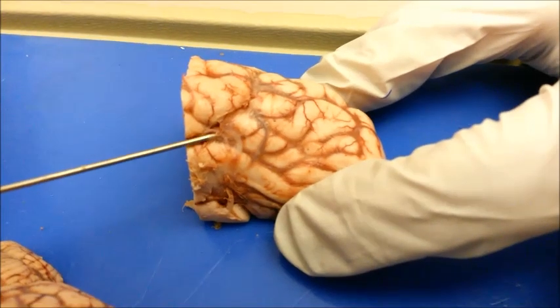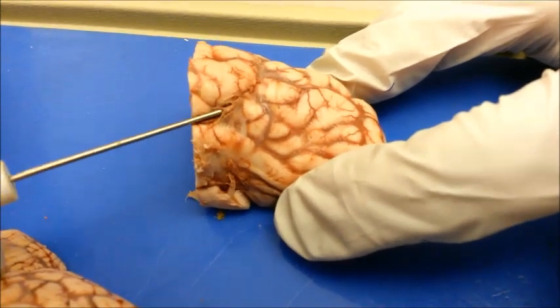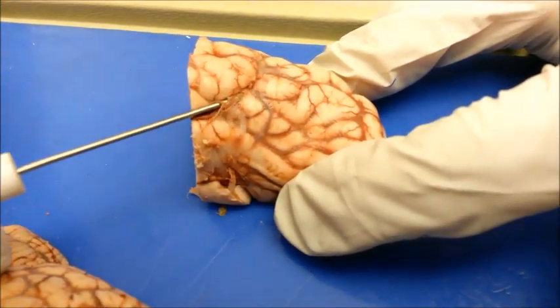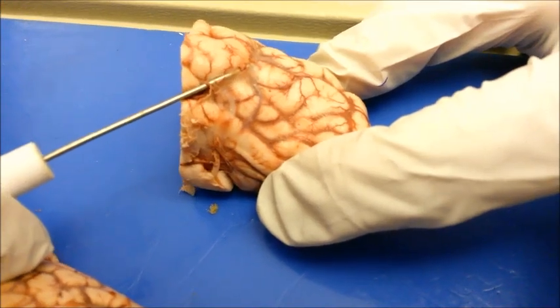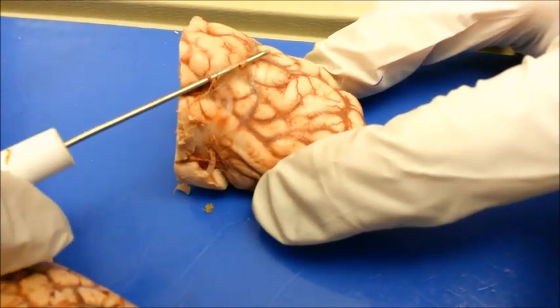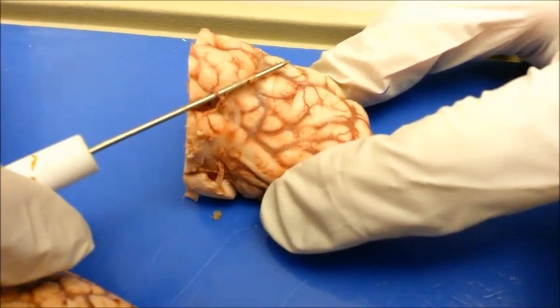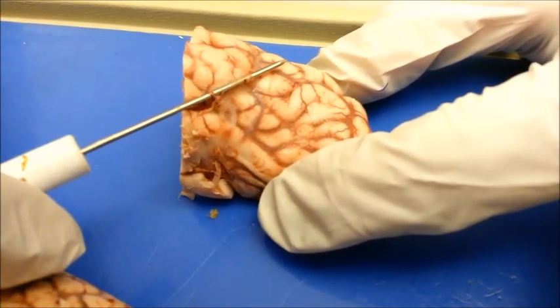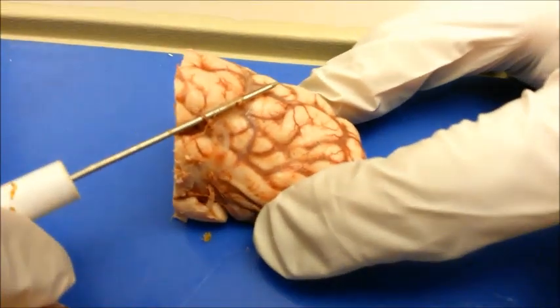Here is the pia mater, which is the innermost layer of the meninges. It covers the surface of the brain and spinal cord. Although the first two layers are not present, they are respectively called the dura mater and the arachnoid mater.